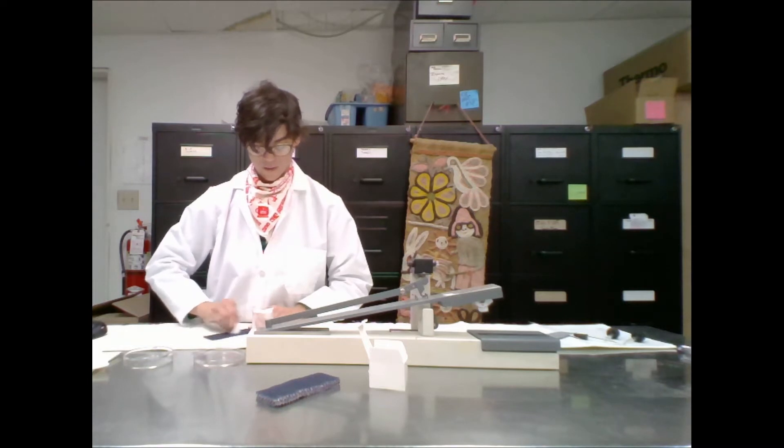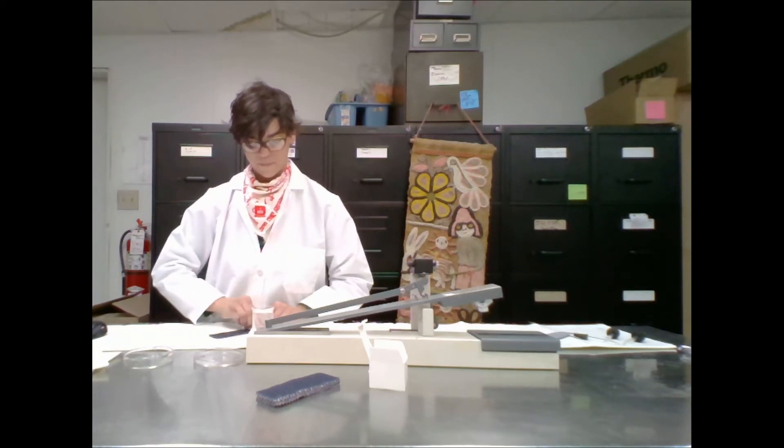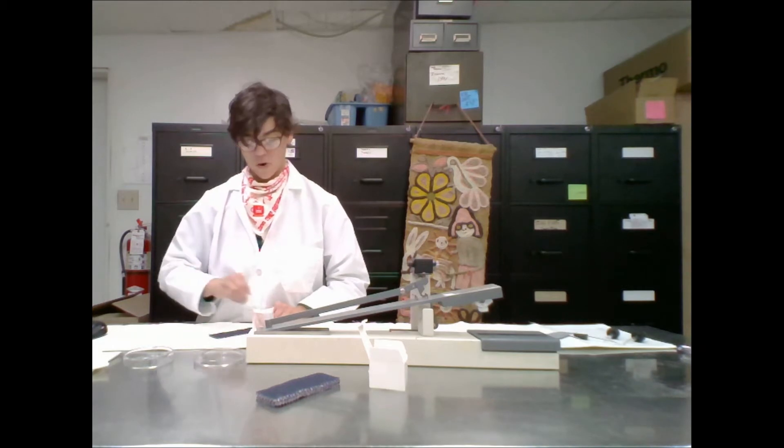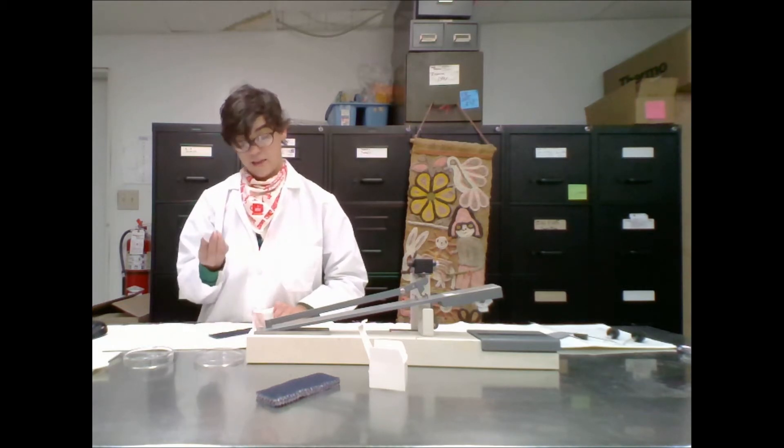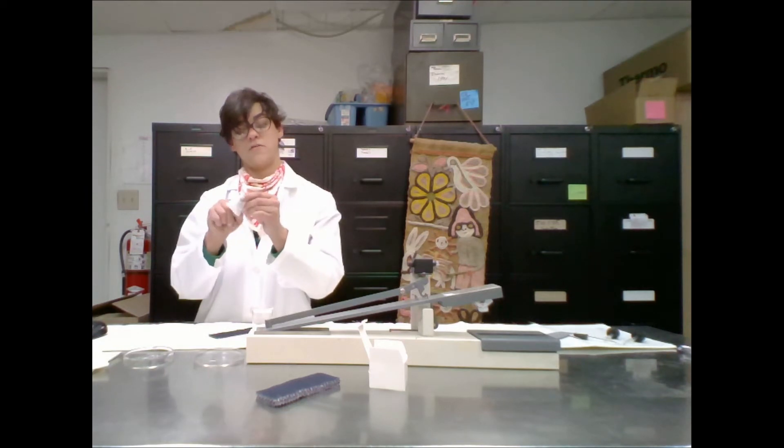Counting one through ten while rubbing. You want to make sure even pressure is applied for all your rubs. And that did show that some color was transferred onto my Croc Finger.